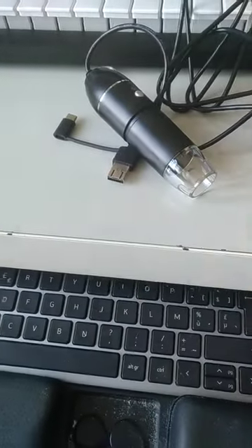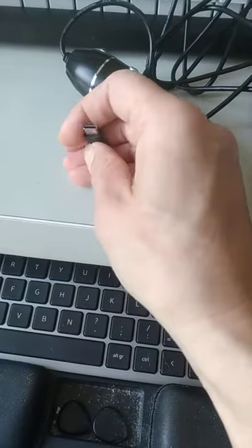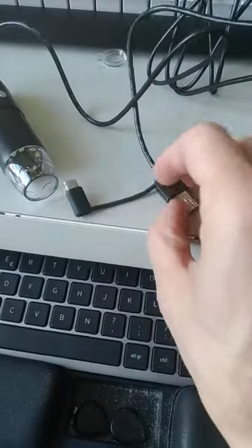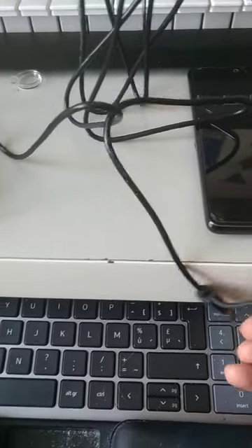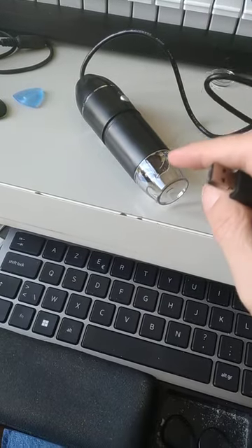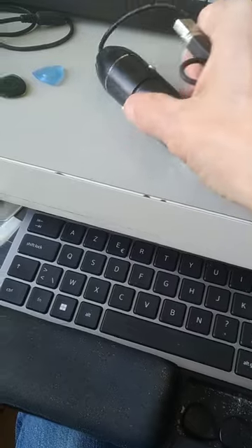Here it is. And so, as I explained, the USB-C thing doesn't work at all. Doesn't do anything. So let me start by demonstrating the regular USB, because there you'll see that the LEDs come on. That's how you know that it's actually being powered. Okay, so I'll go to my computer.